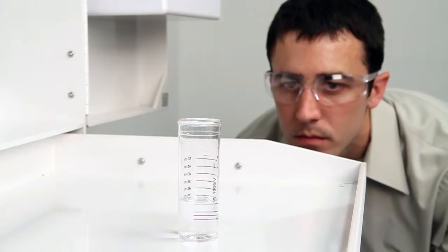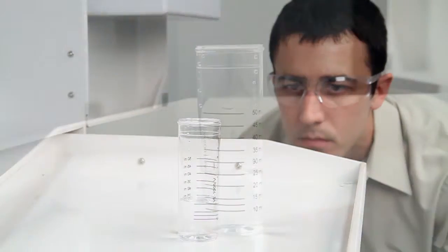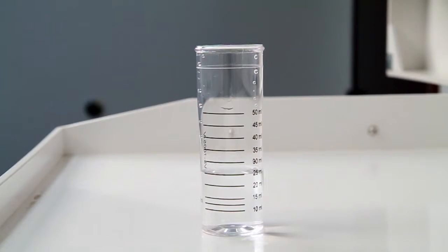Using a white background while performing your test will provide contrast to help you better see the color changes. A white cabinet tray or a paper towel can provide that contrast.